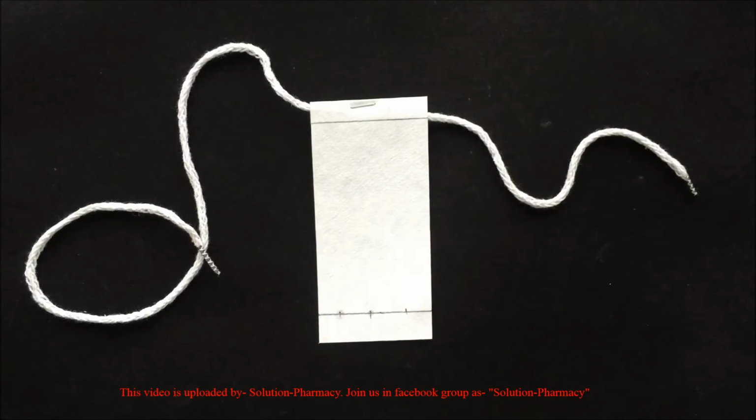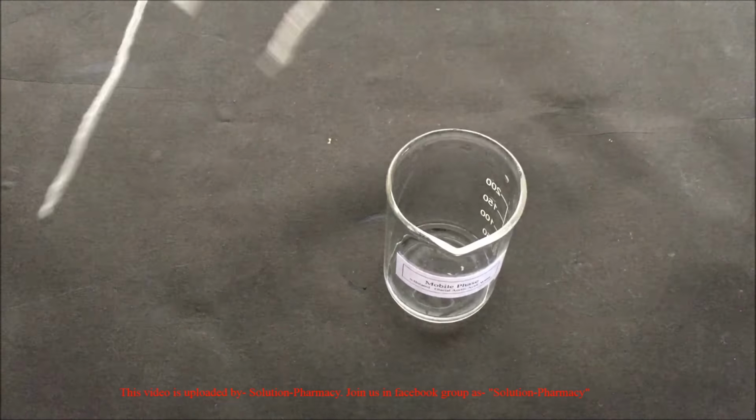You can also label each spot below the starting line for identification. We have a staple thread on the top of the filter paper to hold and support the filter paper in an upright position at the center of the beaker at the time of development. Meanwhile, we have prepared 10 ml mobile phase by mixing n-butanol, glacial acetic acid and water in the ratio 4:1:5 and then allowed the beaker to saturate with the mobile phase vapor.